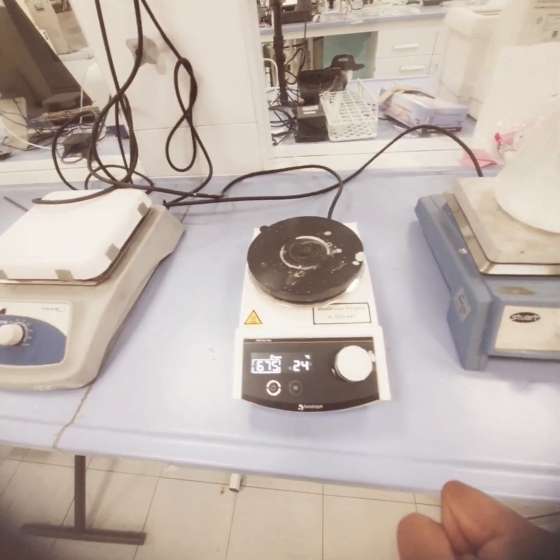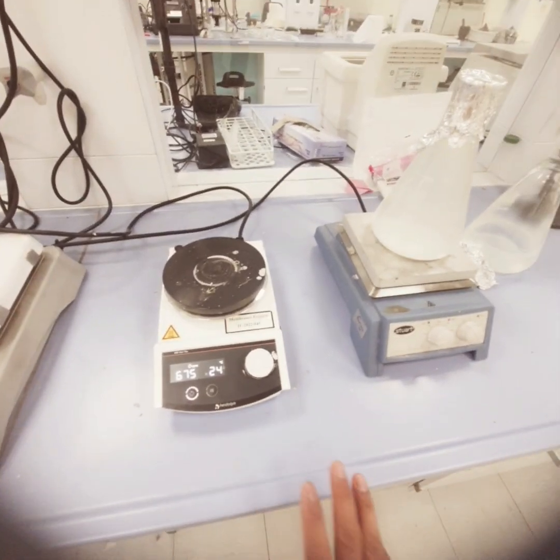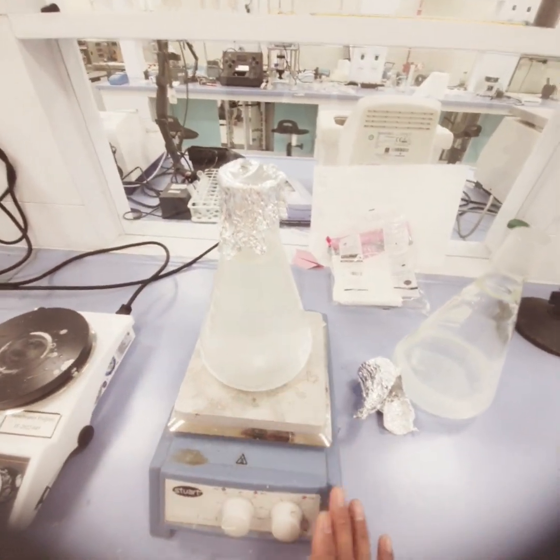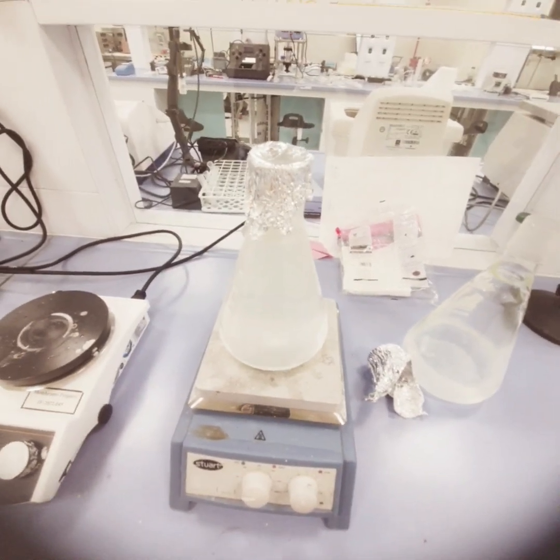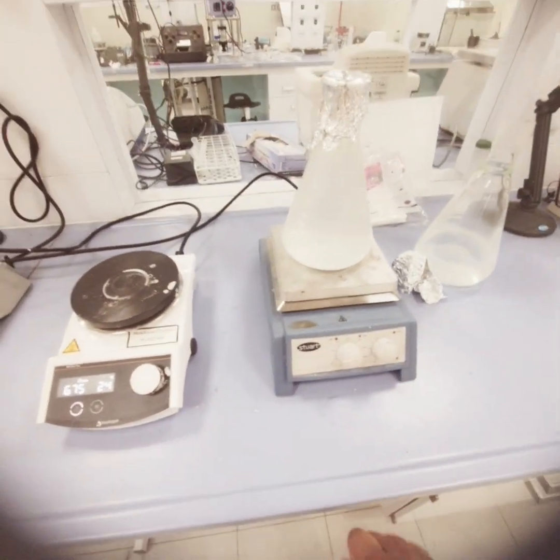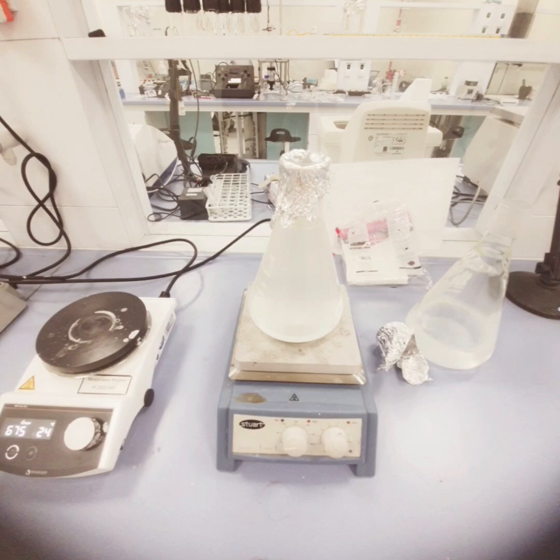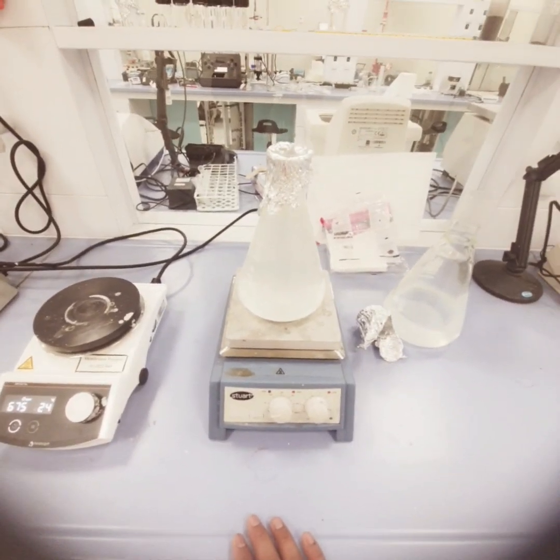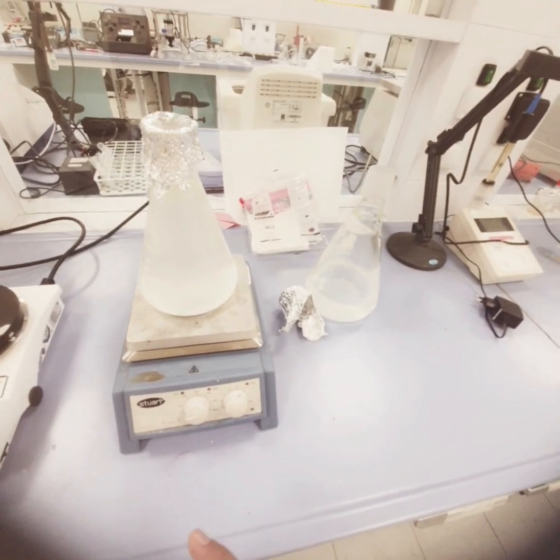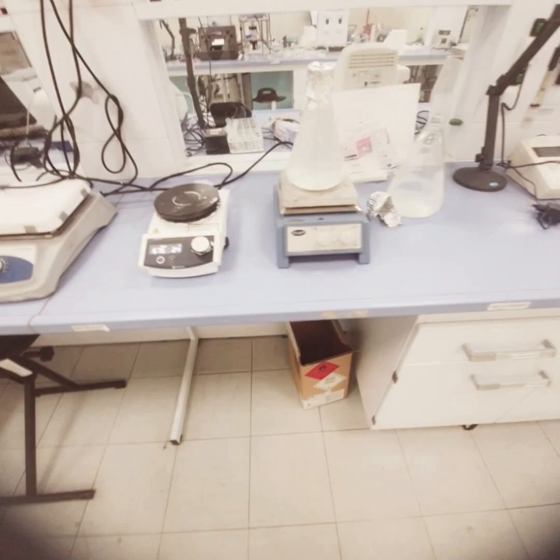So these are various kinds of hot plate stirrer that we have in the laboratory, and as I told you earlier, these are used for mixing of solutions, mixing of stock solutions. We can mix water with oil, water with antibiotic, water with metals. We can make different kinds of emulsions in water, or different kinds of stock solutions, even organic solutions, or solutions containing metals, heavy metals, organics. So this is all about the usage of the hot plate stirrer in the laboratory.